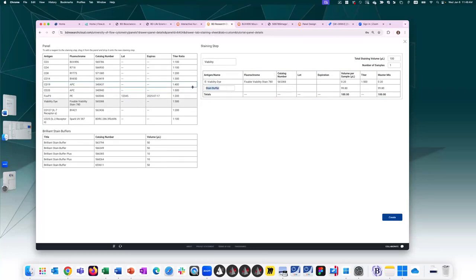I can say what the staining buffer is. For viability dye, I don't like using wash buffer. I want to avoid any protein as to not interfere with any of the amine dyes. So viability dye, PBS, all I have to say is what my total staining volume is and how many samples I plan to stain with. Let's say if I leave the default 100 and I plan to stain 5 samples, the math here gets automatically updated, and I can then know exactly what the volumes are for the master mix. So this will create stain step 1.